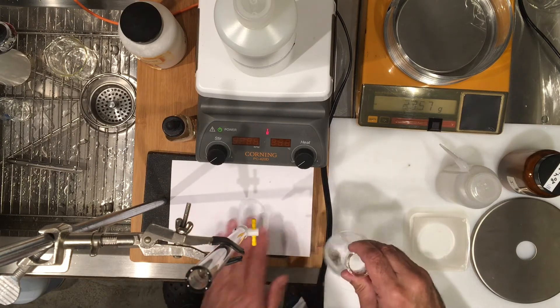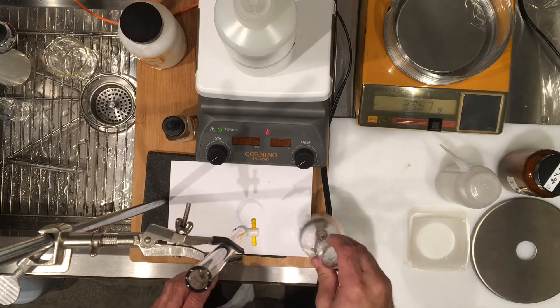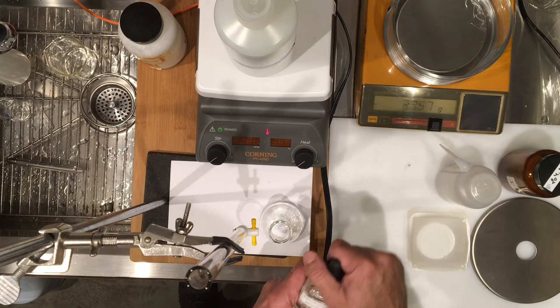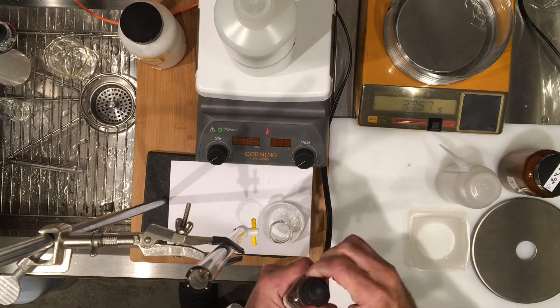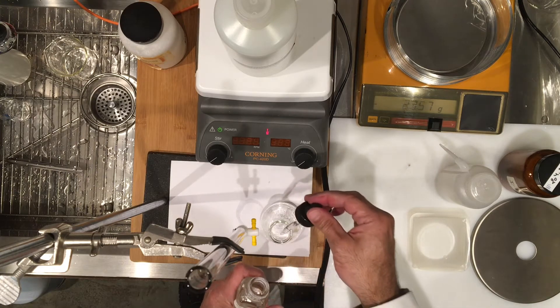So I put a white background for my titration so I can see the color change, and I'm going to use an indicator called phenolphthalein. This indicator is prepared in alcohol and I'm going to put like two or three drops of the indicator inside of the flask.